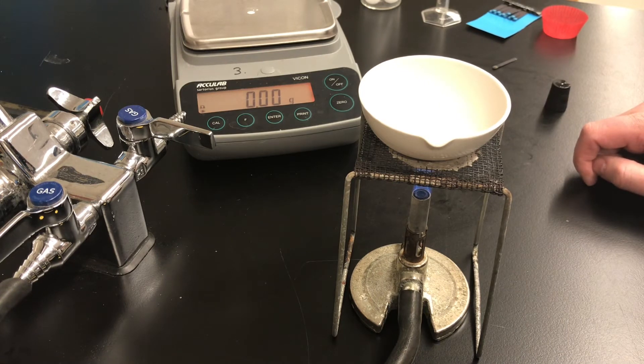In the video you're unlikely to be able to see that salt. We're going to be heating this for several minutes. I'm going to pause the video and we'll come back in a couple of minutes.